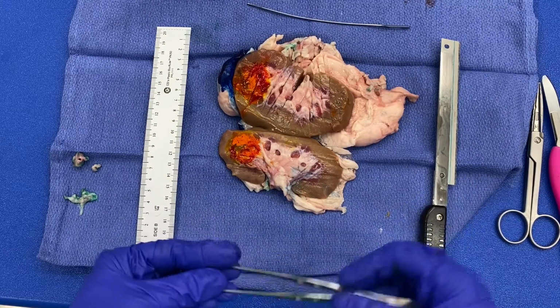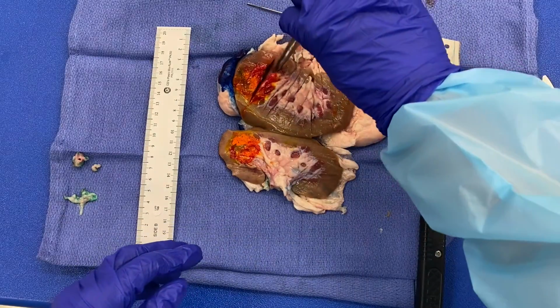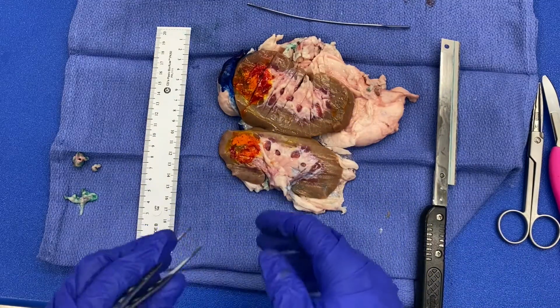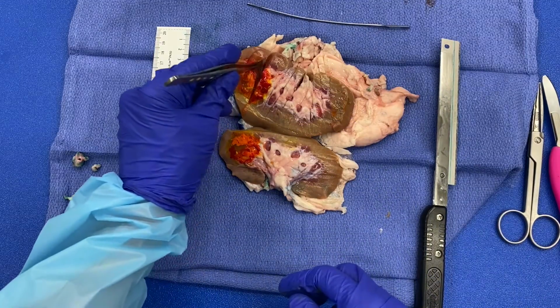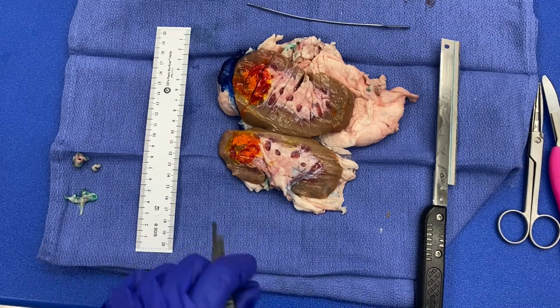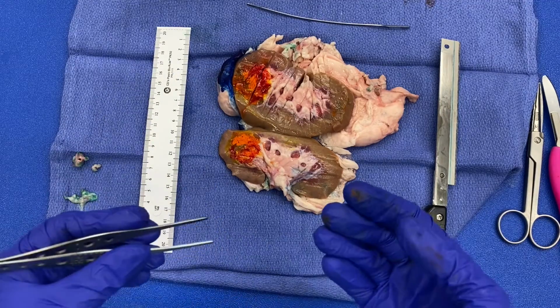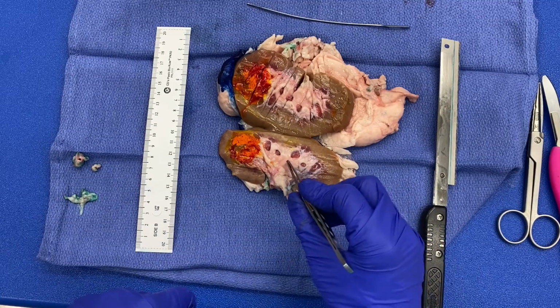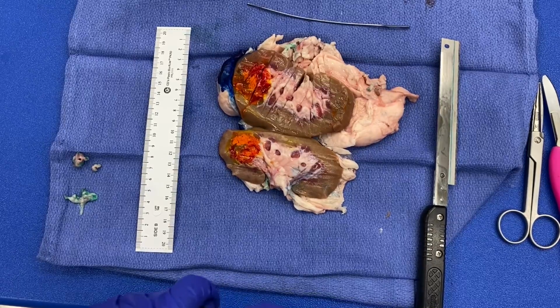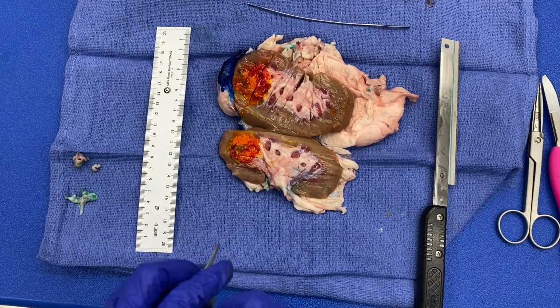So what you'll need to do is, of course, measure the tumor, but you need to make sure that you're including both halves together. So after you cut and determine the greatest extent of that tumor within the renal parenchyma, remember this is not a depth of invasion. We are not invading deep into this parenchyma. The tumor originates in the parenchyma. If it was originating in the epithelium and invading down through layers, then you would have a depth of invasion, but in this case, it's not a depth of invasion. You're just measuring the greatest of 3 dimensions of the tumor.